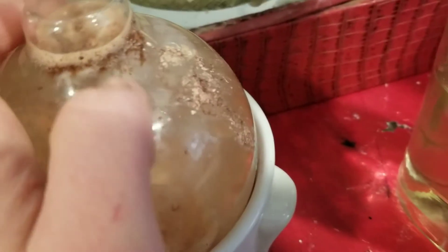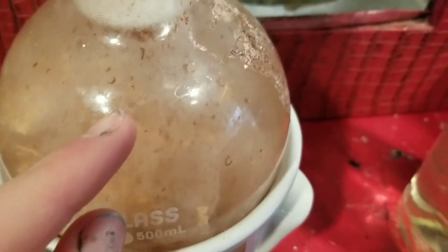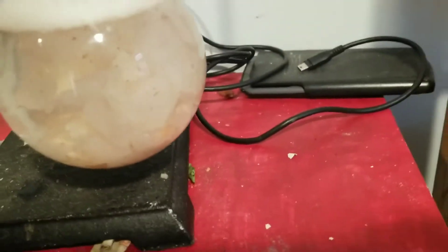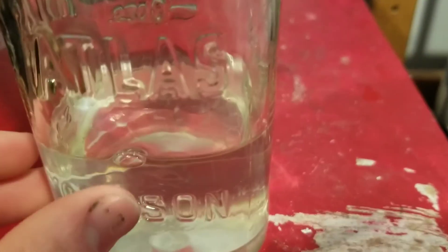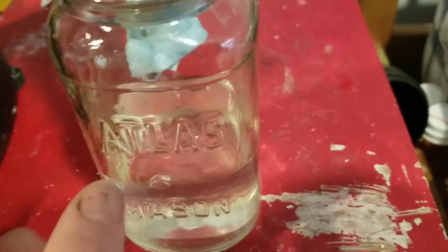If there's anything that could potentially put our calcite crystal purity in danger, it's probably going to be these eggshells — they're supposedly 98% calcium carbonate. When cooking up the reaction, you would like to only fill the container halfway. During the first couple of hours when the reaction is most vigorous, you have to shake it around to make sure the eggshells sink back down. To get the best yield, you have to allow the reaction to go on for at least one day before you start filtering.